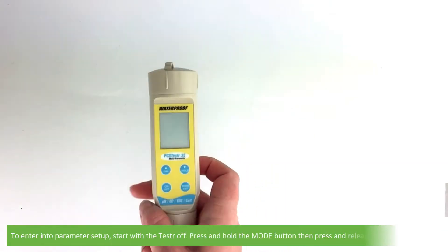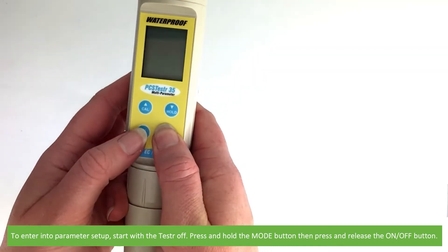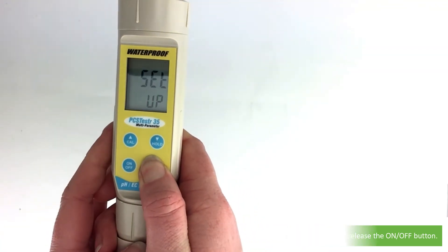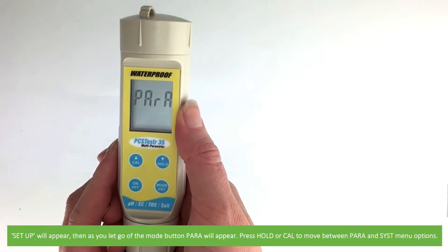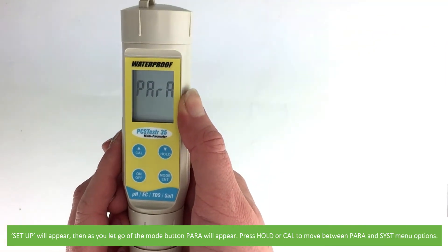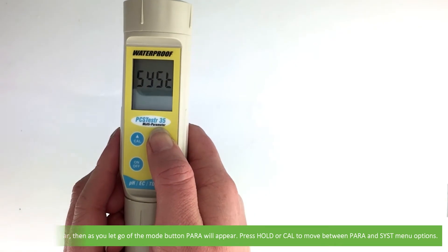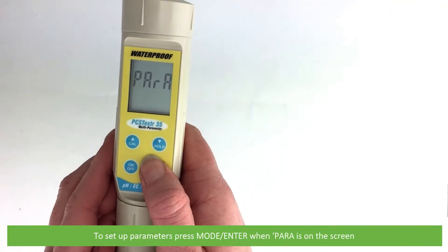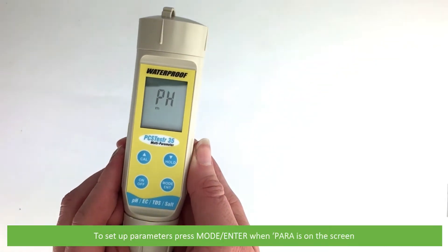To enter into parameter setup, start with the tester off. Press and hold the mode button, then press and release the on-off button. Setup will appear. As you let go of the mode button, para will appear. Press hold or cal to move between parameter and system menu options. To set up parameters, press the mode enter button when para is on the screen.